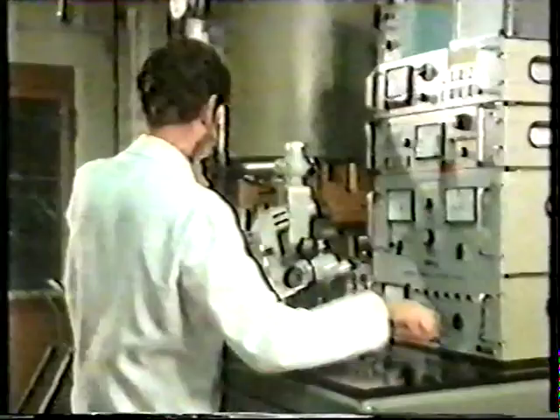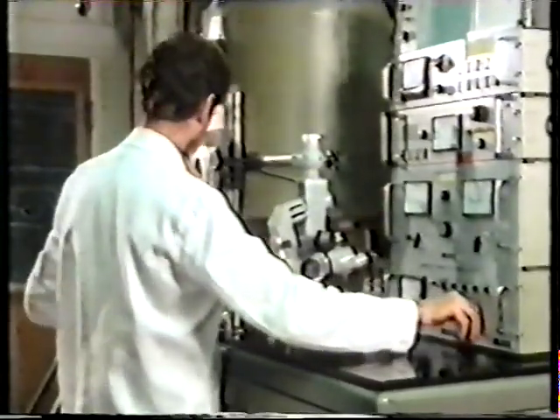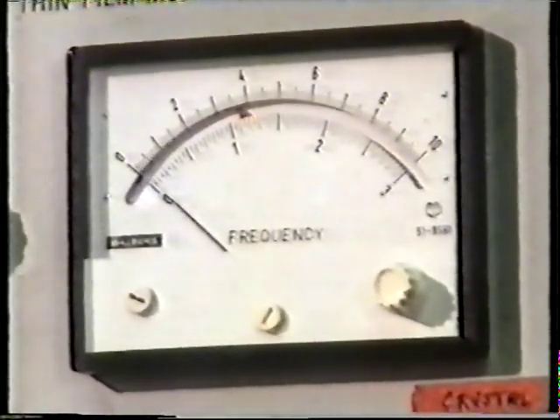Once the specimen is inside the freeze etch machine, the bell jar is lowered, evacuated, and then the knife is used to cut the specimen itself. Thin slivers are shaved away, and the fractured surface that's left of the specimen is what is then replicated using the electron bombardment guns.